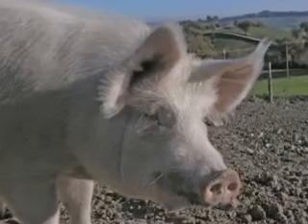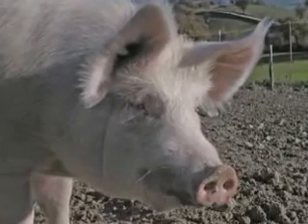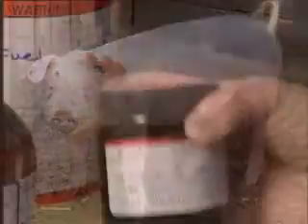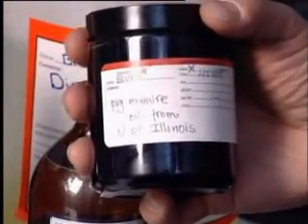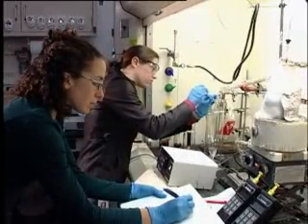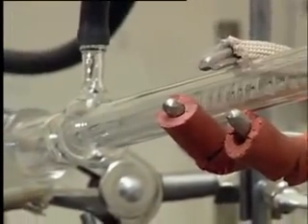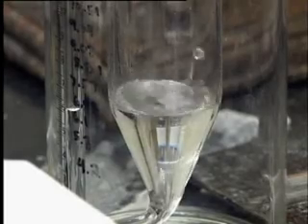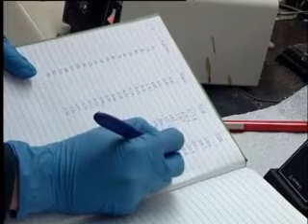Here you have a material that's a complete nuisance — it has no value whatsoever — but his research group has been able to turn it into a fluid, and I have a little bit of it here, that's very similar to a crude oil. We've applied our advanced distillation curve approach to that fluid and we can use it to determine what areas the pig manure fuel can be used in.